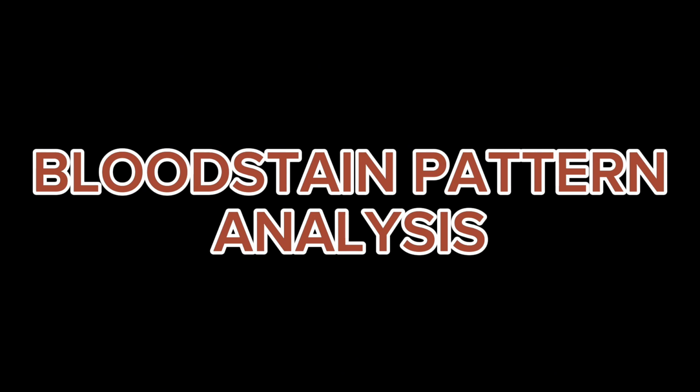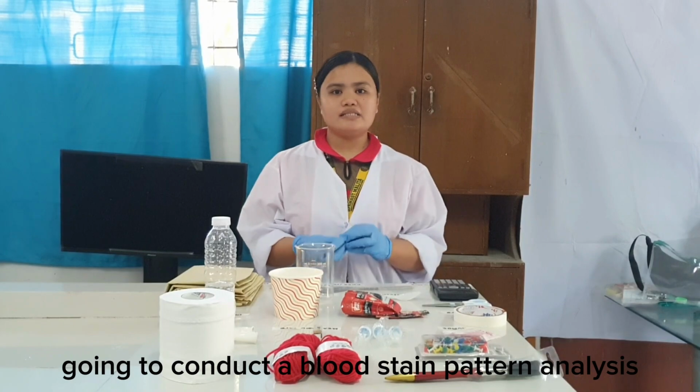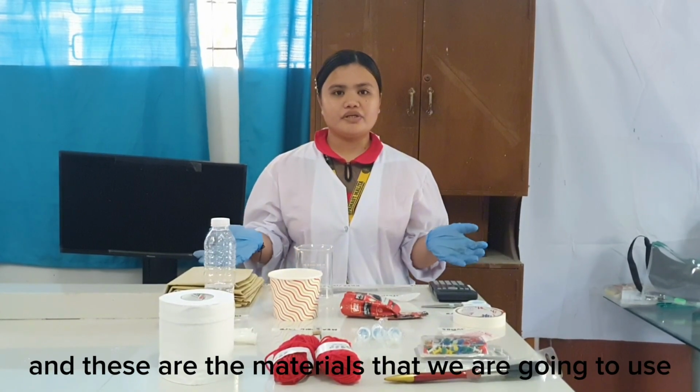Bloodstain pattern analysis. Good day everyone. Today we are going to conduct a bloodstain pattern analysis, and these are the materials that we are going to use.